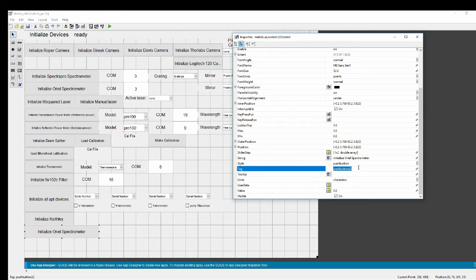This one is the button that's going to initialize communications with the Oriel white light filter. And I've written that we need to call that the Oriel white light filter initialize. And the string, instead of Oriel spectrometer, it should say white light filter. Something like that. Make sure it fits, looks good. And okay, once the tag is done, that's fine.